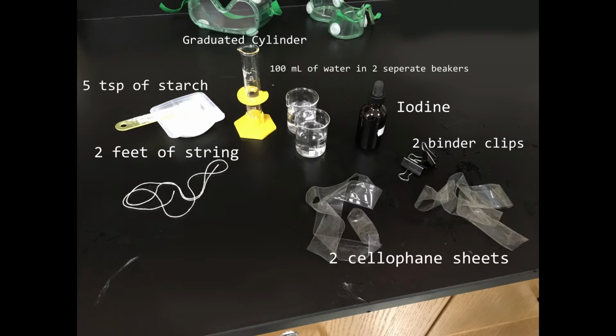The equipment will include 2 beakers large enough to hold 50 milliliters each, 1 pipette found in the iodine bottle, 2 binder clips, and of course, the usual lab safety equipment of goggles, gloves, and aprons.